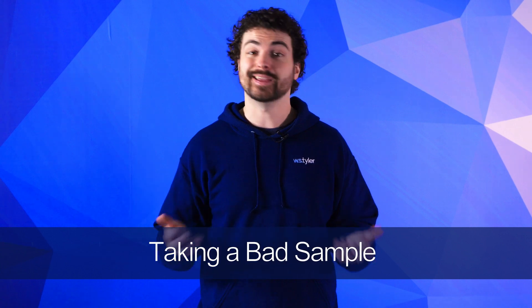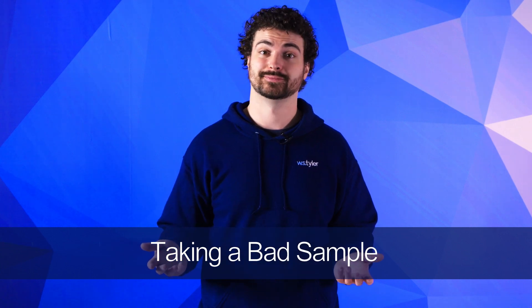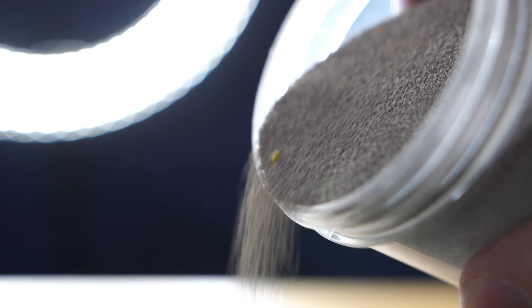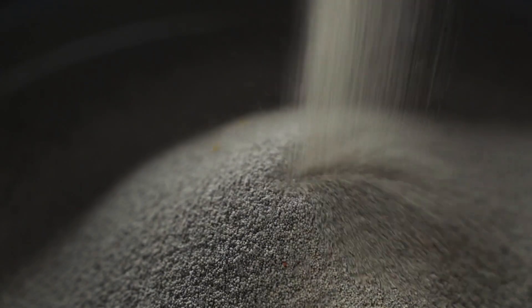Your results will only be as good as your representative sample. So it's imperative that you use best practices when gathering and handling your sample. This includes using either the coning and quartering method of sample division, or using a splitter to create even sample portions.